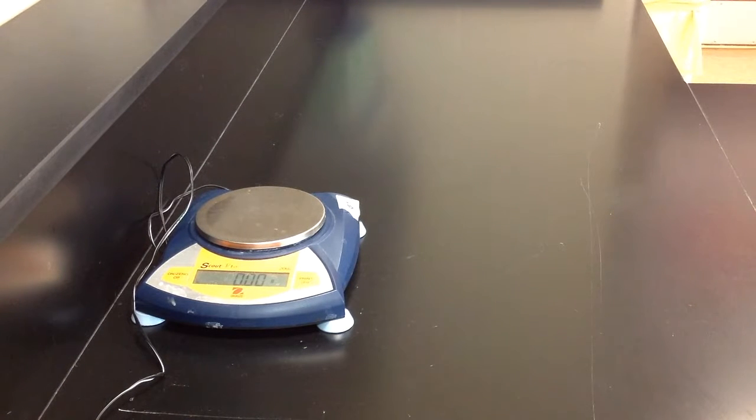Hello class! In today's video, we're going to be walking through the counting by weighing activity.